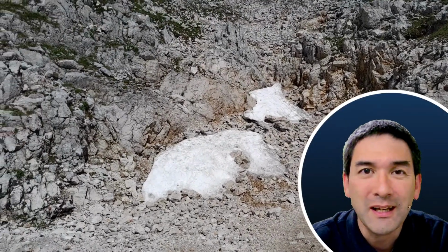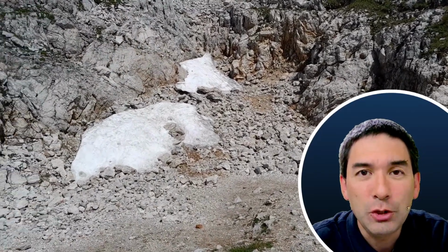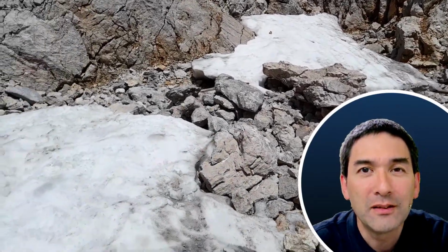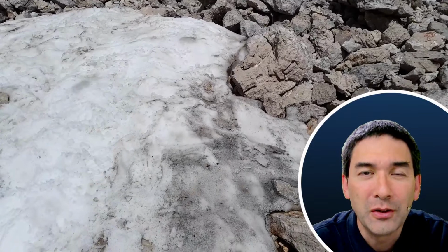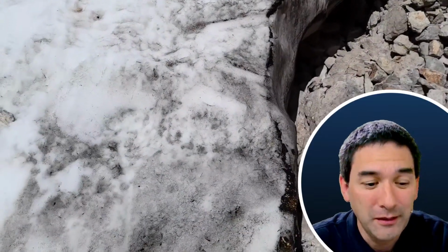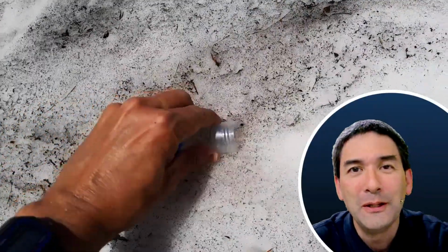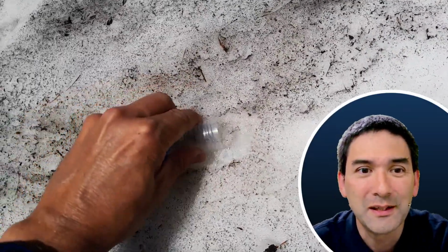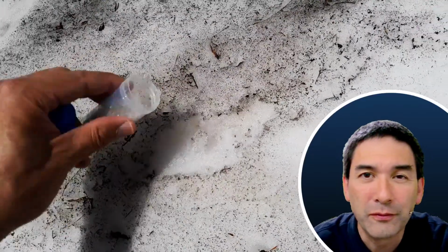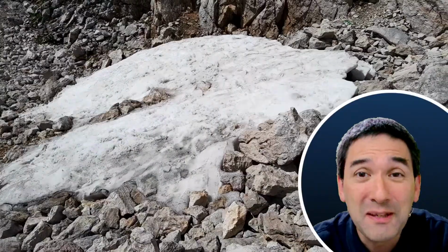Today I would like to put some glacial water, actually not so much the water, but some of the black stuff that I found on some snow about 2 weeks ago under the microscope. I've got the sample over here, and you can already see in the video that I'm collecting some of the top surface layer of the snow where I could find all of this black deposit, and I wanted to find out what it is, and basically here we are.